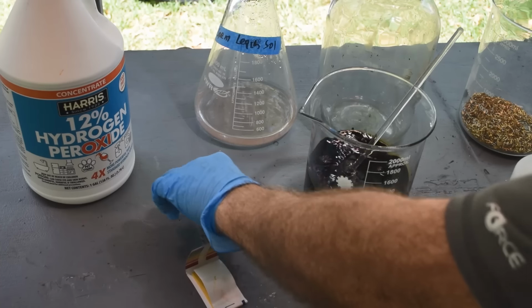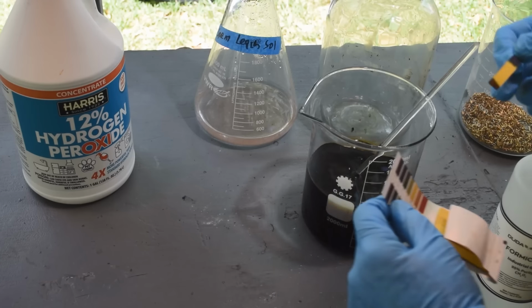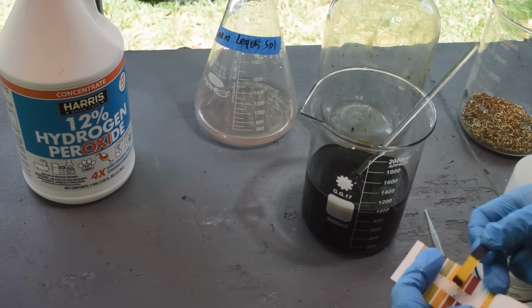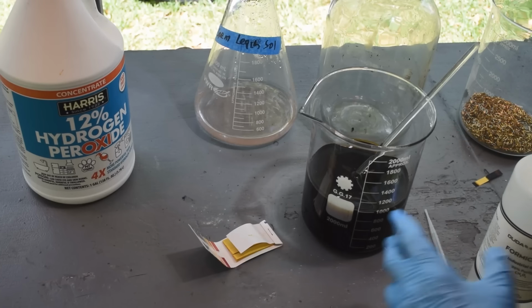All right, let's have another look at the pH. I think I can reuse this paper. Let's see what we got here. Of course, now we got a lot of free iodine in there, so that's going to screw us up a bit. It looks like we are right around 6. So I think that's pretty good. I think that is pretty good.